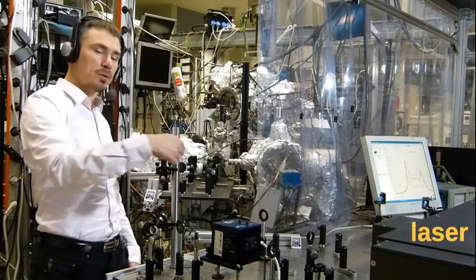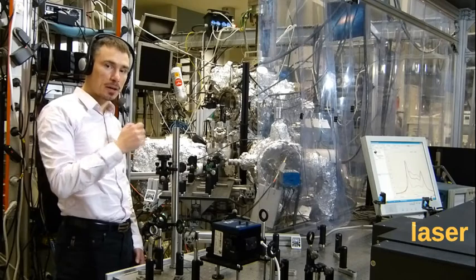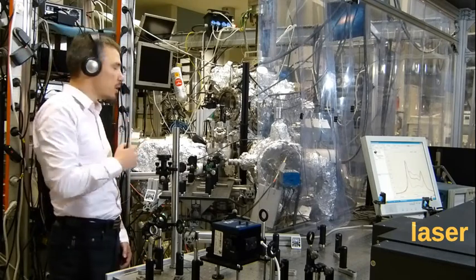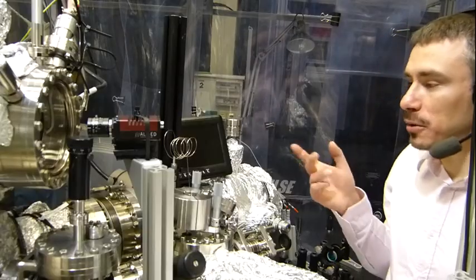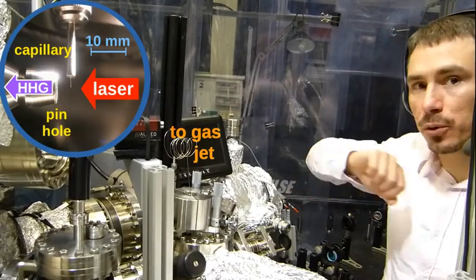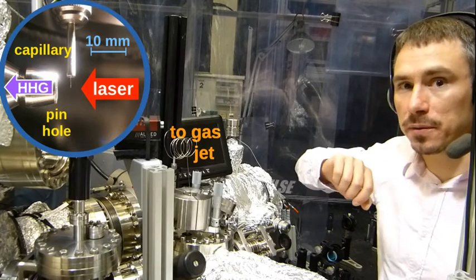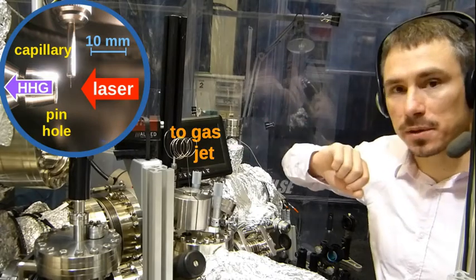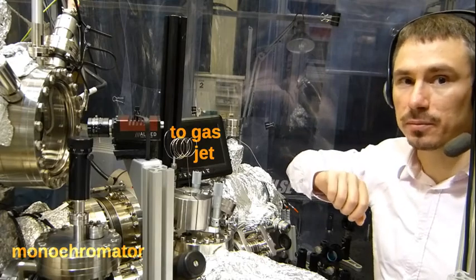With just a few optical components, we guide the laser beam into the ultra-high vacuum chamber where the high-order harmonic generation takes place. The laser beam is focused into a gas jet there, and we can have a closer look at the generation now. In our generation chamber, the gas comes from the top through a capillary, and the laser is focused just at the tip of the capillary into the gas jet. There the generation of the high-order harmonic light takes place, and afterwards there's a monochromator with a toroidal grating where we can select the energy to do photoemission.